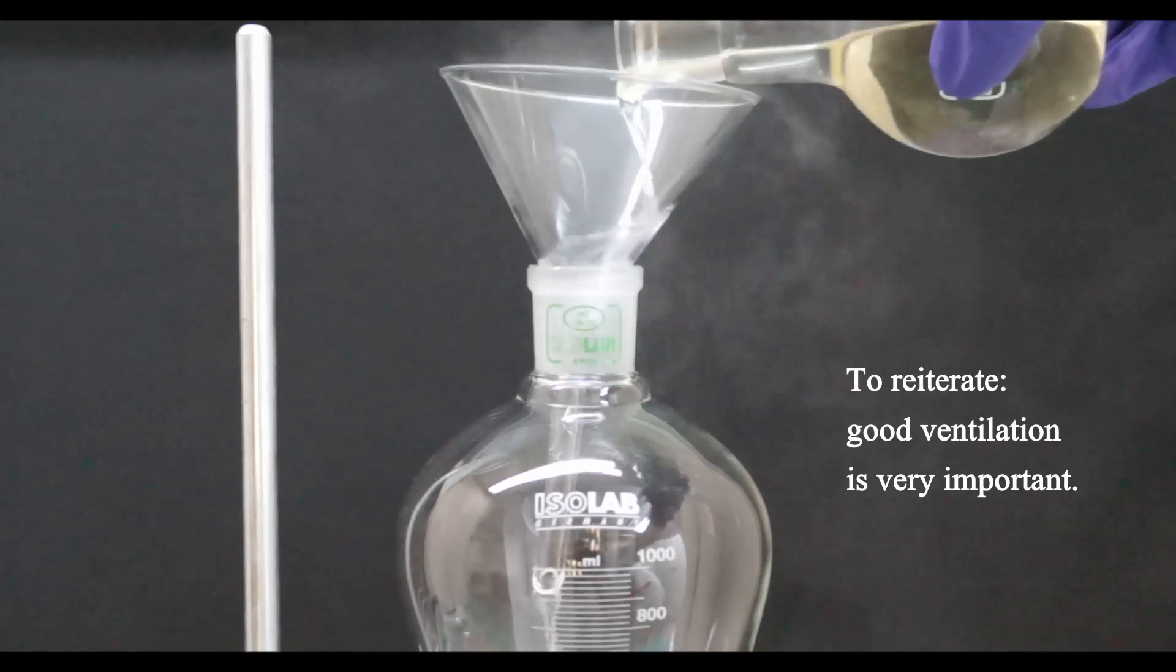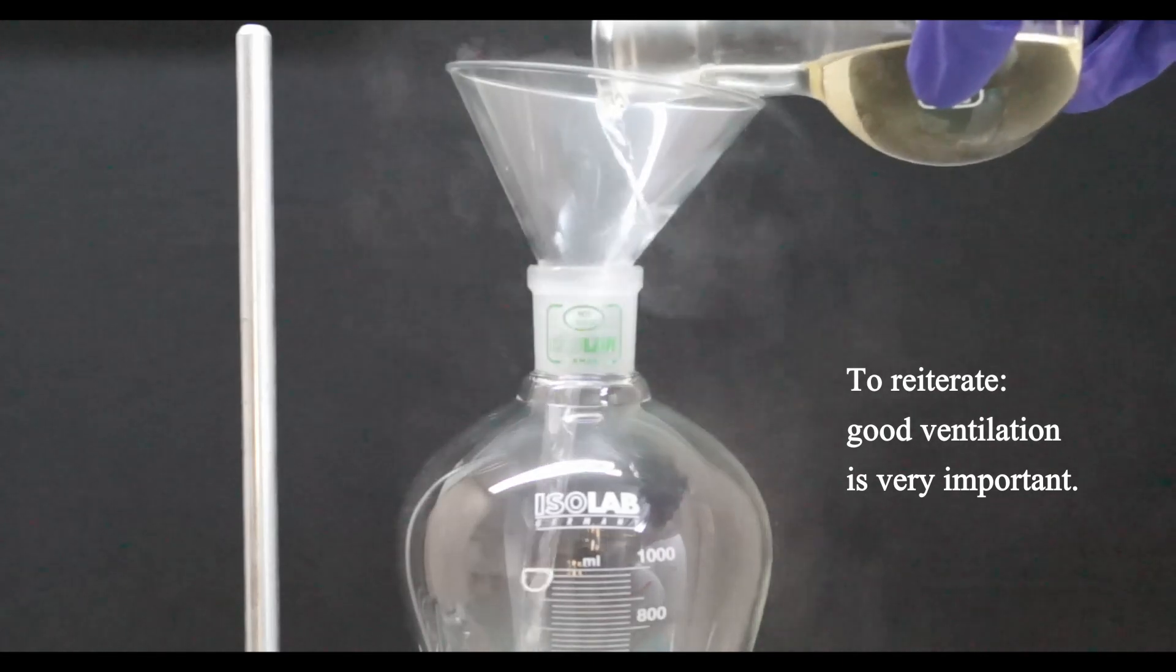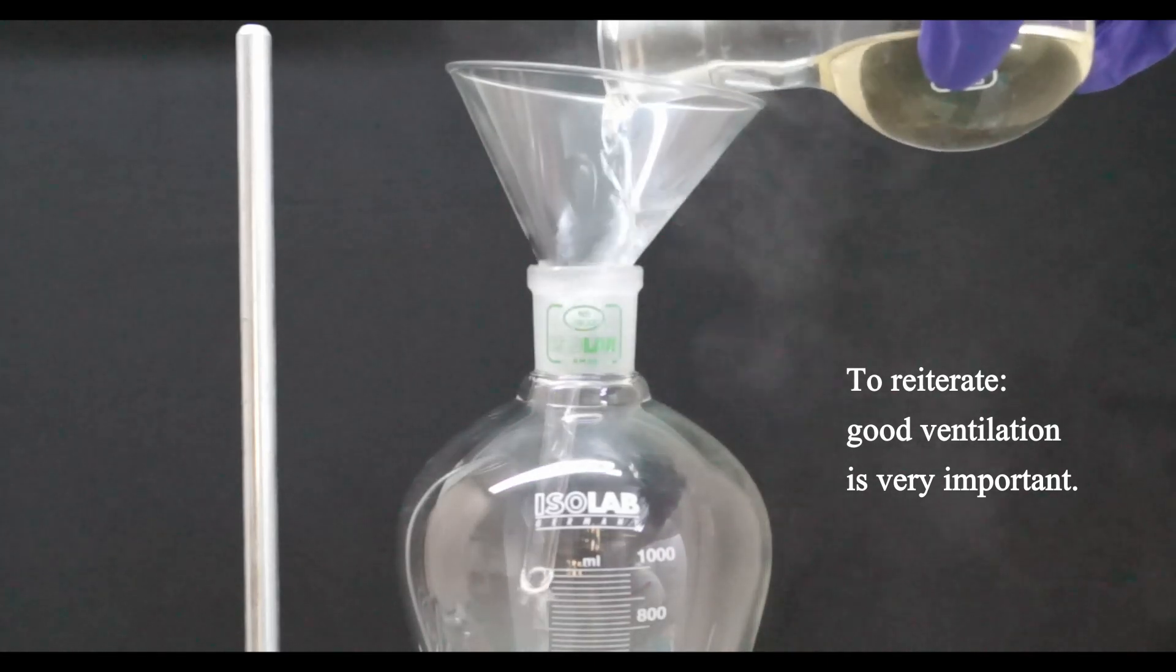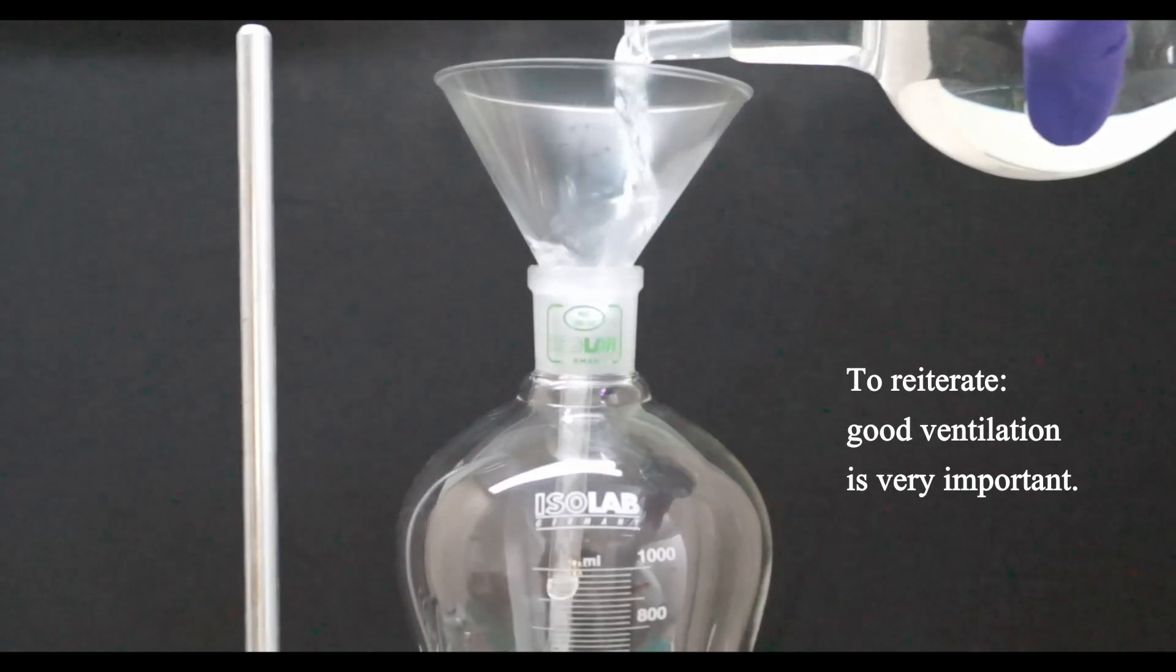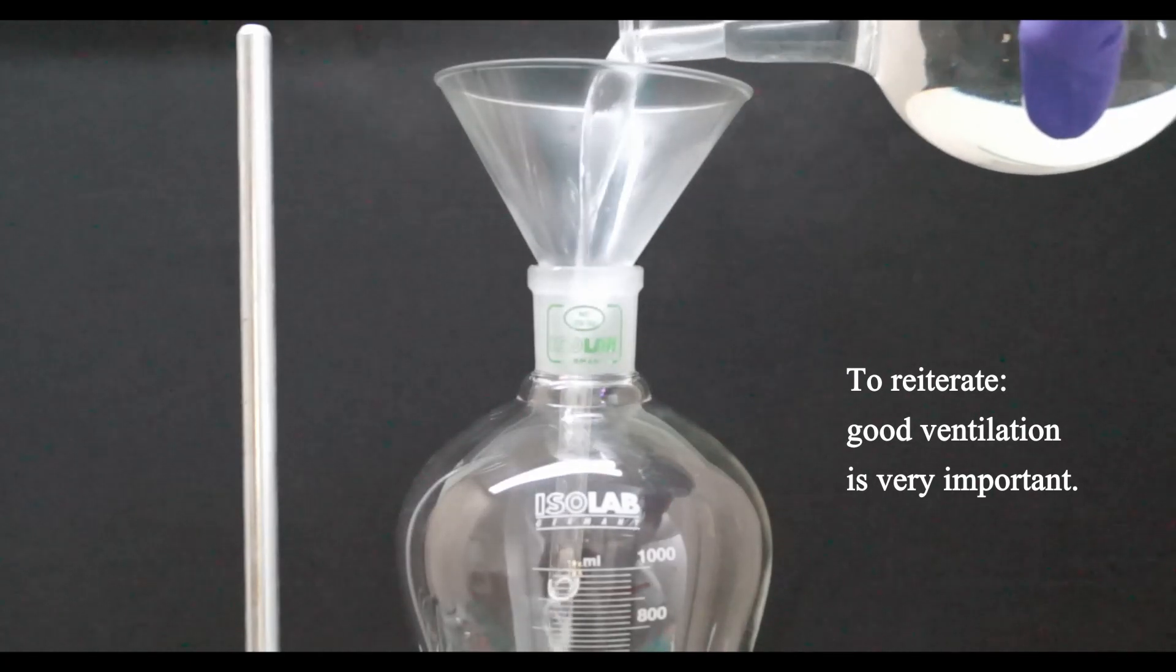As can be seen from the smoke as I charge the one liter separatory funnel with both crude products, they are both contaminated with large amounts of dissolved hydrogen chloride gas.